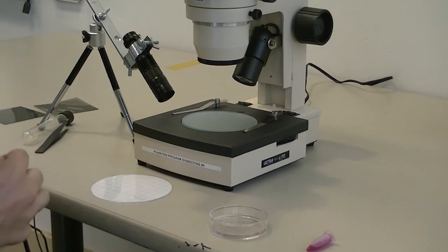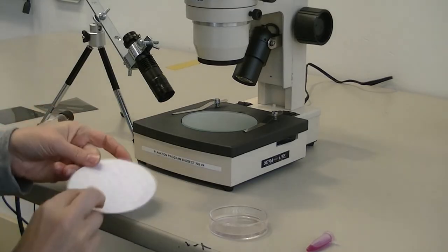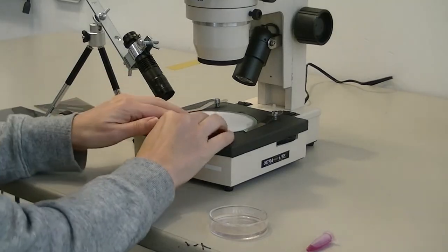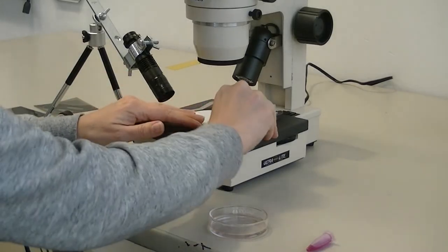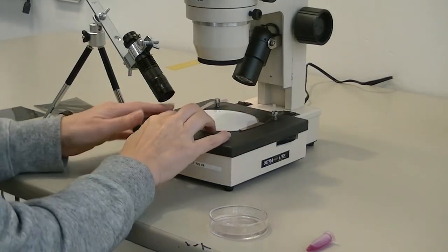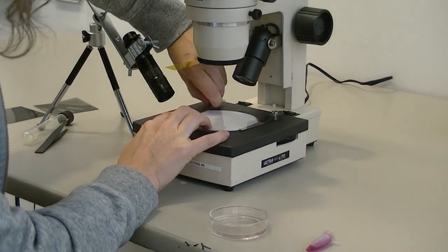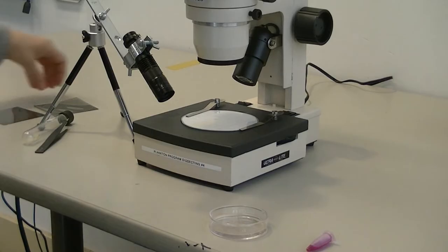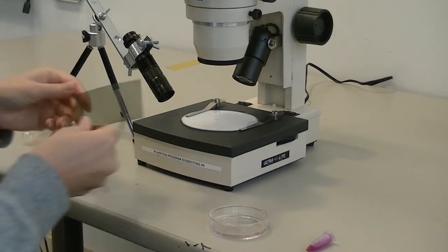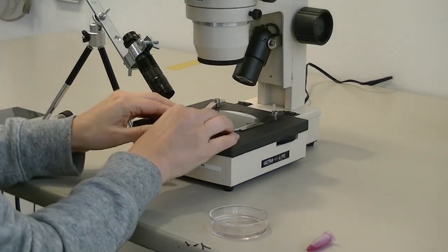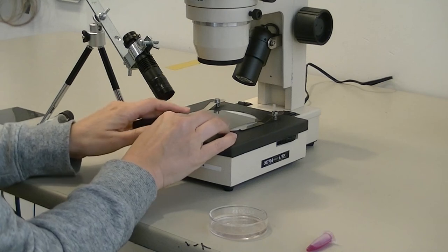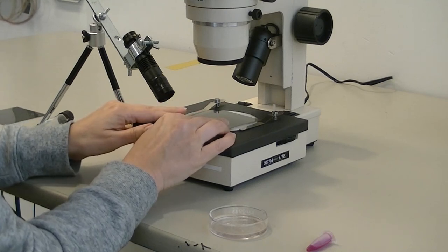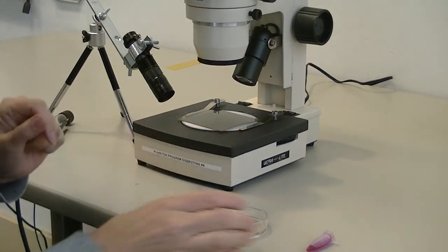An hour has passed, and we're ready to look at our sample with the Nile Red solution. We want to put our millimeter graph paper on the scope for measuring pieces, and one of our polarizing films for the polarizing process.